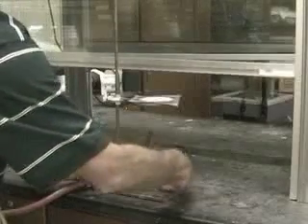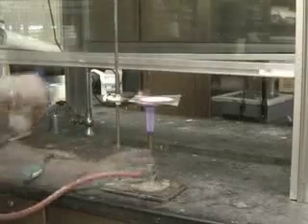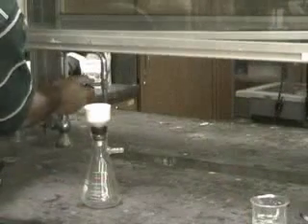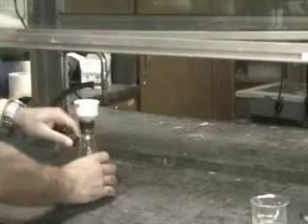First we dissolve the mixture and then heat it up to make sure all the potassium nitrate and copper sulfate dissolve. The silicon carbide does not dissolve and stays as a solid, which can be separated by filtration. Using a Buchner funnel, we filter out the solid silicon carbide.